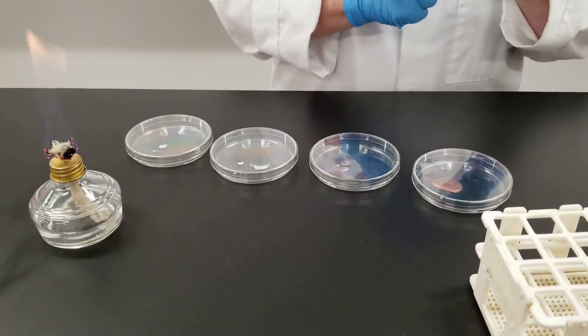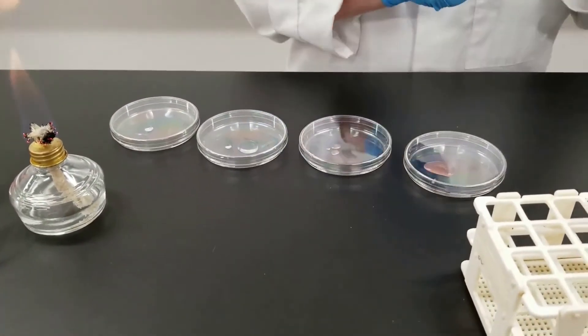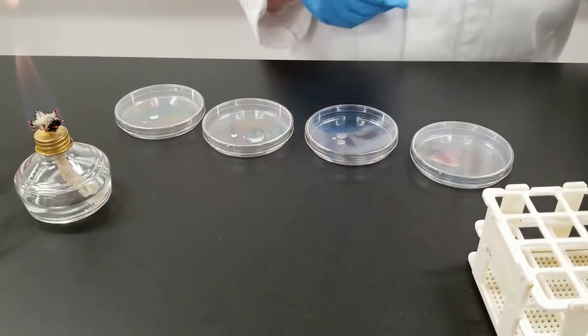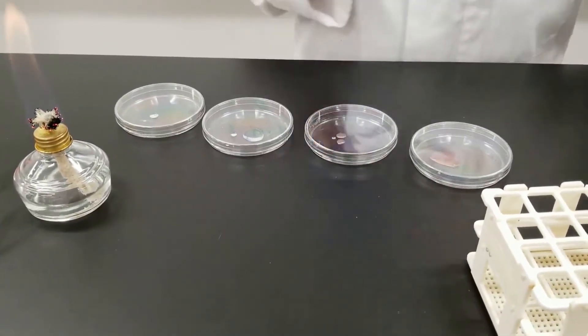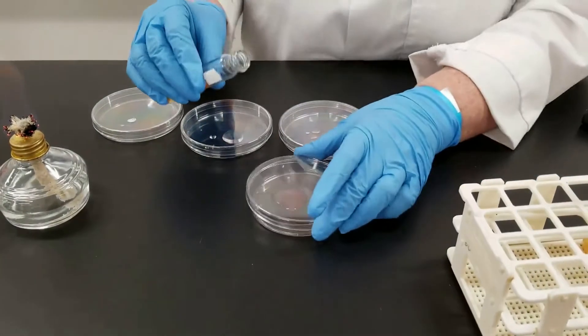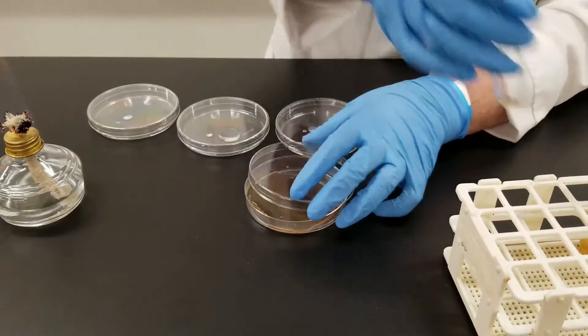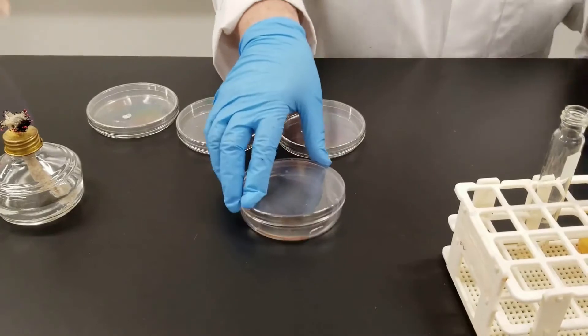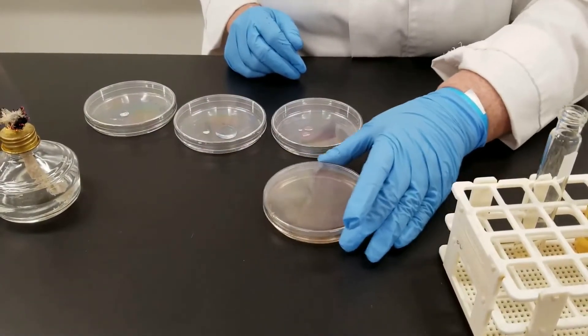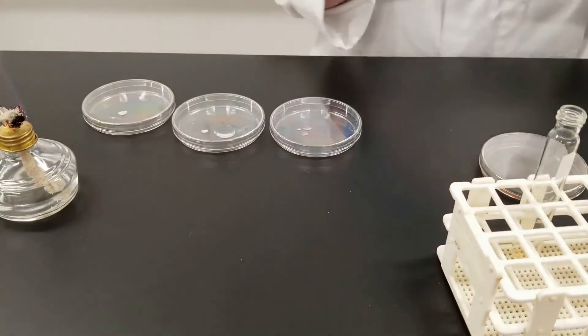Check our agar that have been in a water bath. We don't want them too hot, but we don't want them too cool because then they will solidify too fast. So the pour plate, remember we just pour the agar in, swirl the plate, get it nicely mixed in there, set that aside to let it solidify.